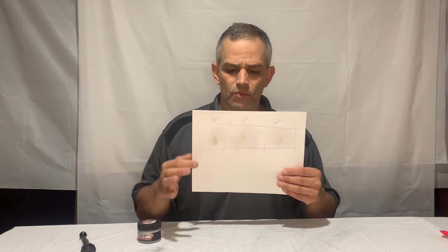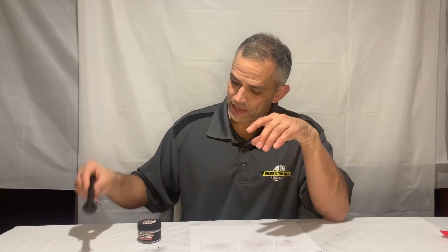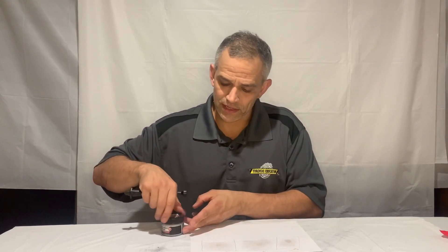Here's how I set it up. I have three boxes — one, two, three. I'm not going to use those nice oily prints; I'm just going to use my regular fingerprints from the eccrine sweat glands. I use different fingers, because if I use the same finger for all three prints, by the time I get to the third one it'll be worn down. So I use one finger for day one, another for day two, and a third for day three. I already did this three days before filming so I didn't have to wait during recording.